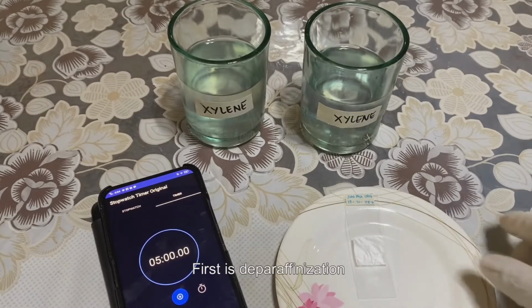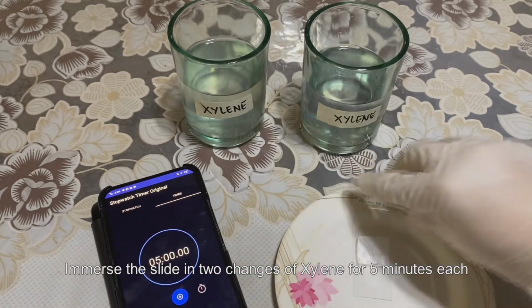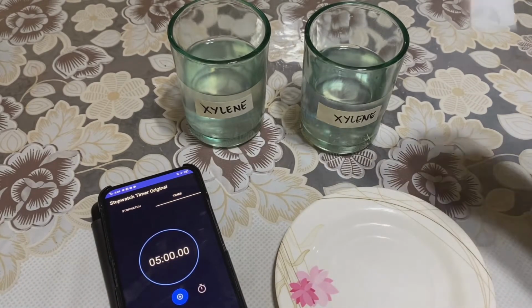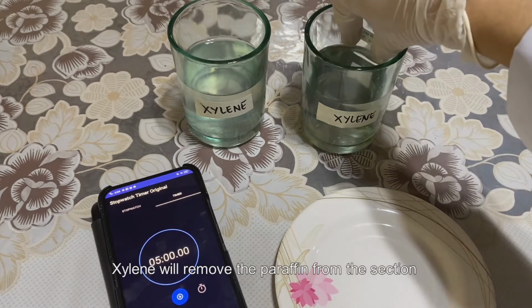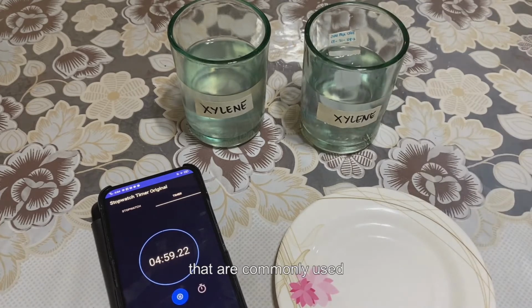First is deparaffinization. Immerse the slide in 2 changes of xylene for 5 minutes each. Xylene will remove the paraffin from the section, since paraffin is insoluble with the aqueous stains that are commonly used.